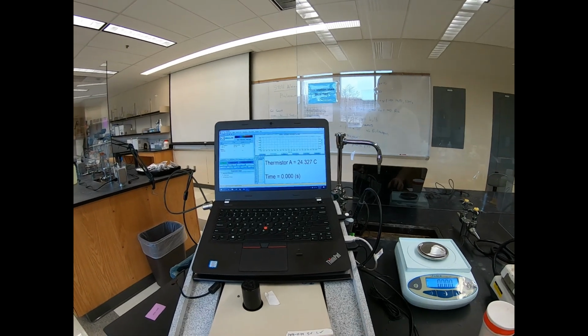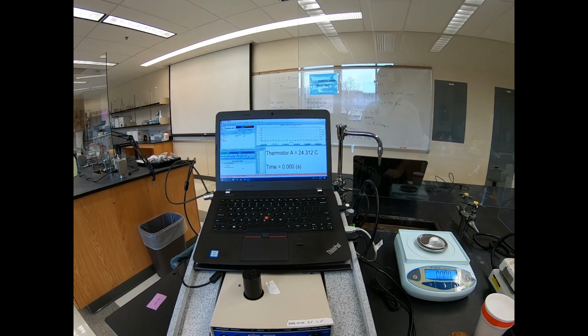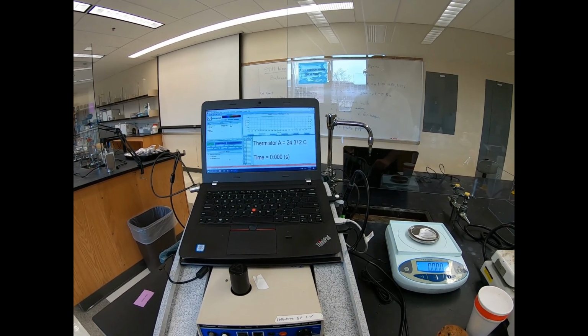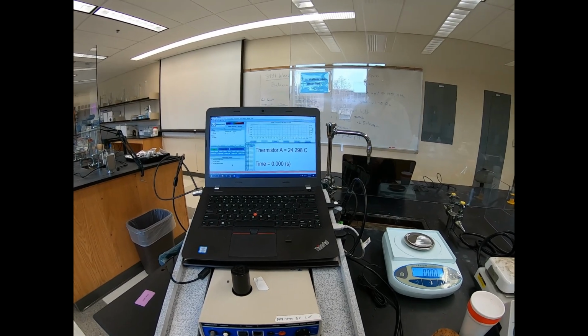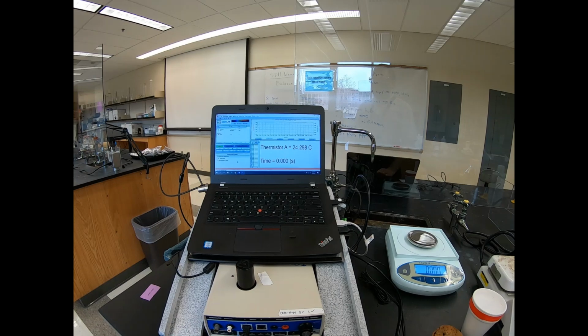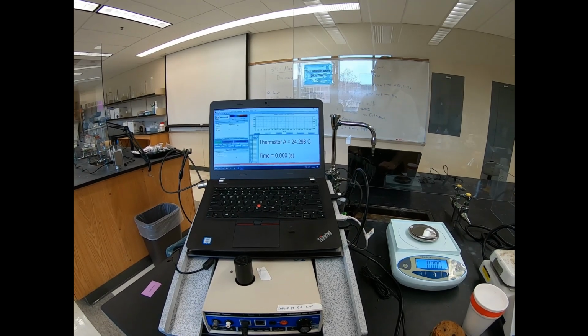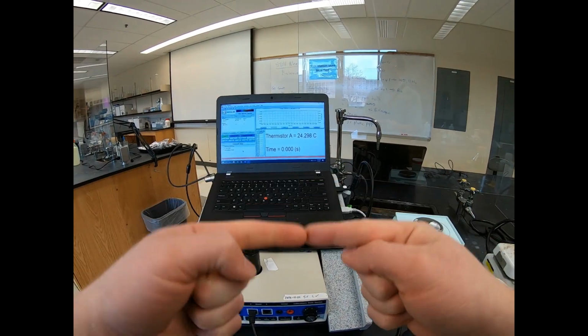All right, welcome everybody. So this is now going to be the second video for Chem 128 Lab 5, decomposition of ammonium chloride. We are now going to be doing 3 trials, so this video is only going to be trial 1, for the reaction between ammonia and hydrochloric acid. So we're trying to find the change in heat when ammonia and hydrochloric acid react.